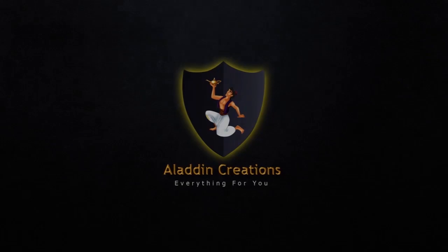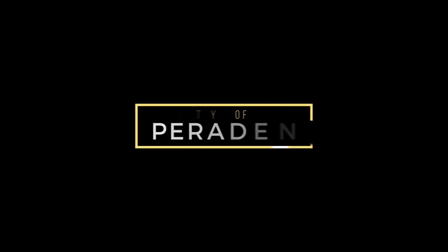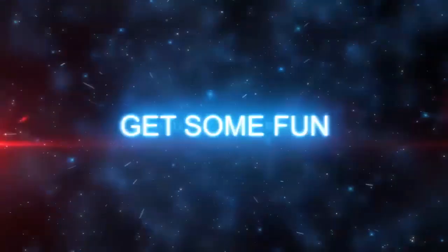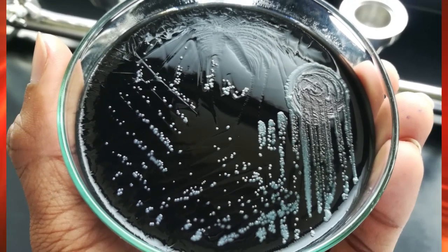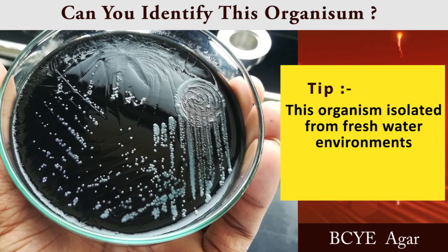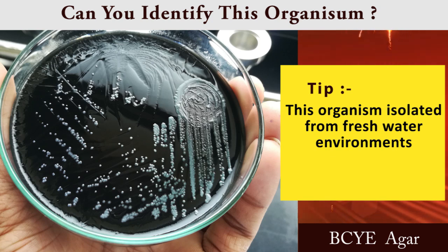Aladdin Creations. Can you identify the organism in this BCYE Agar media? This organism was isolated from freshwater environments, and we were able to see this type of colonies after 36 hours of incubation.